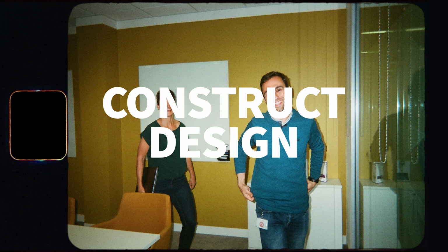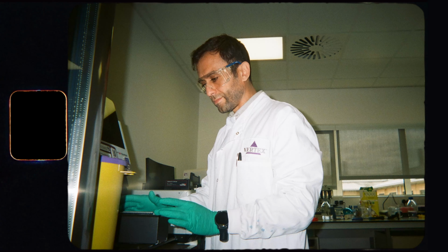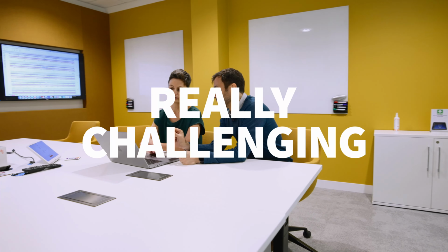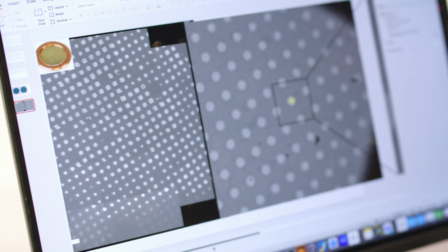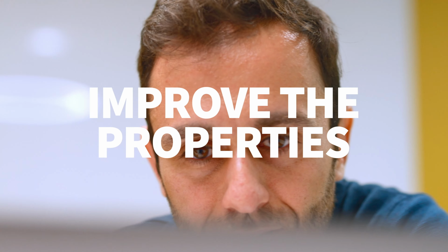I'm going to meet up with Chady to talk about construct design for the proteins that we want to try and purify this month and all of that cool stuff. We started off the day looking at construct designs for some really challenging proteins that we're struggling to express and purify at the moment. We try to use technologies that will bring us very specific details within the protein structure that will enable us to improve properties of this protein. We can try maybe a couple of variations.